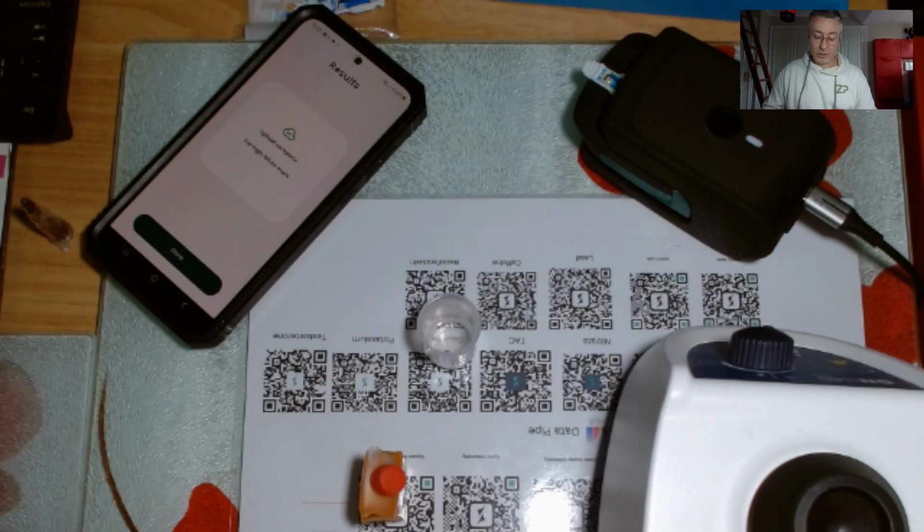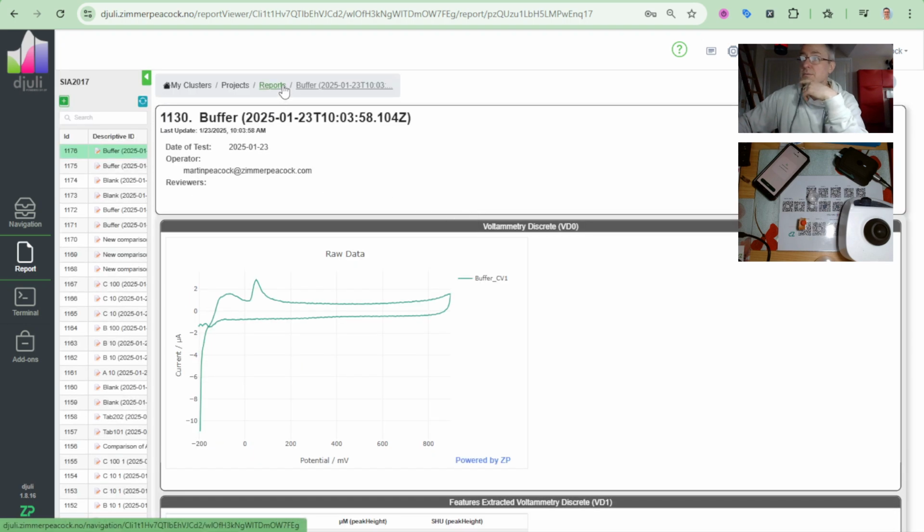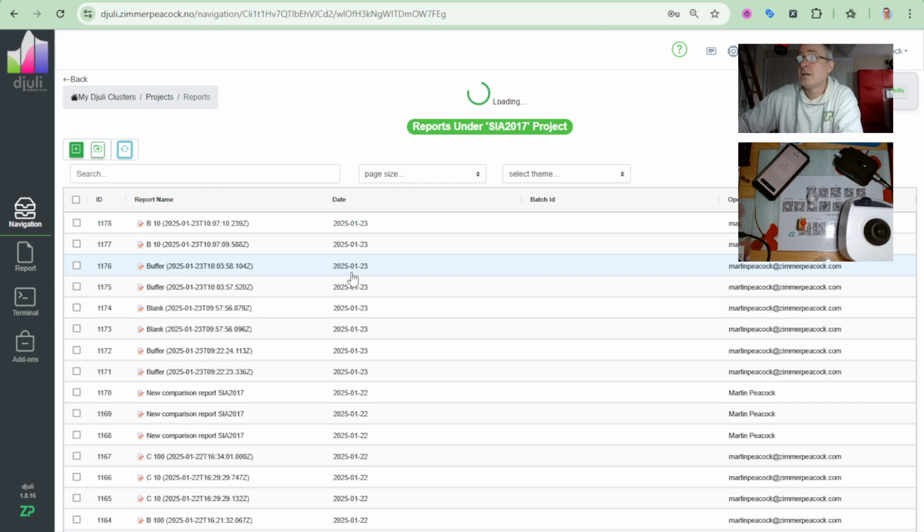But what I can't quite explain is how they can take the same sample and get too low and then too high. When I look at their too low data, there is no capsaicin in that sample. When I look at their too high data, there definitely is capsaicin in their sensor. And I can reproduce that. If you can reproduce something, by the way, that's one of the foundations of science. And science, I would suggest, sometimes is the foundation of understanding. So let's just have a quick look at this. There's the B10, up it comes.